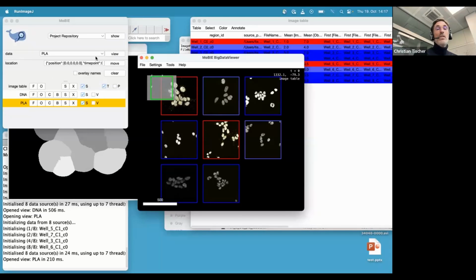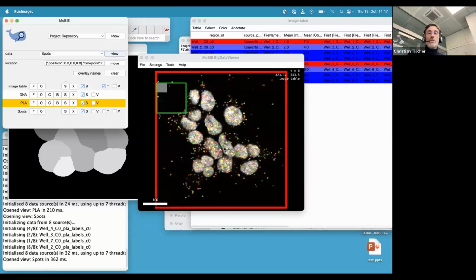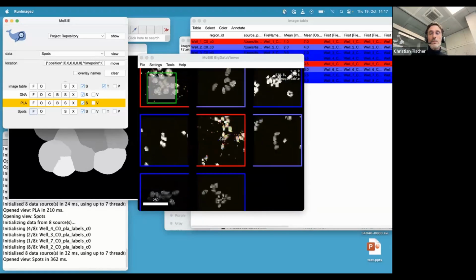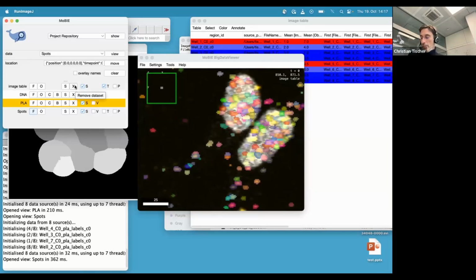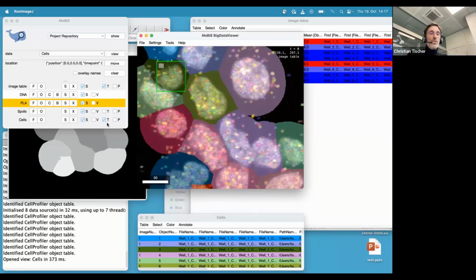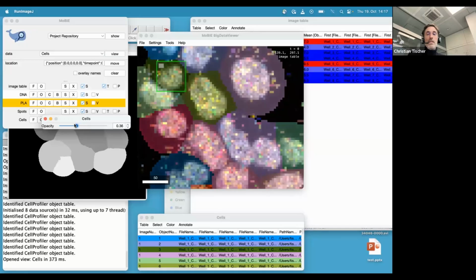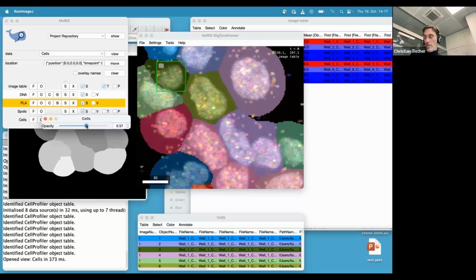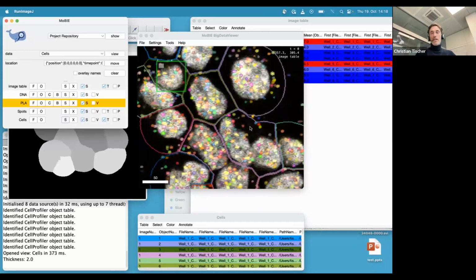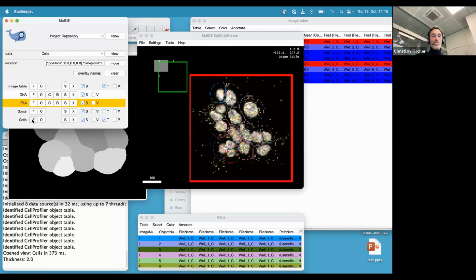Okay, then let's add the actual spots, right? Because to judge if all of that makes any sense, maybe we want to see the spots. And now we have the spots also, and this is the label mask images that here are rendered with just a random lookup table. And then we also care about the cells. So let's also look at the cells. Now we have the cell segmentation on top. And here we can do several things. We can, for example, change the opacity so that we can more or less see through the labels. So I think this is important. And another feature that we also provide is that you say, I actually just want to see the boundaries of cells. So here's a settings button, and then we would only see the outlines. I think depending on what you want to do, that can be also useful.